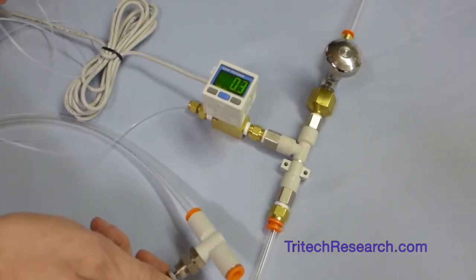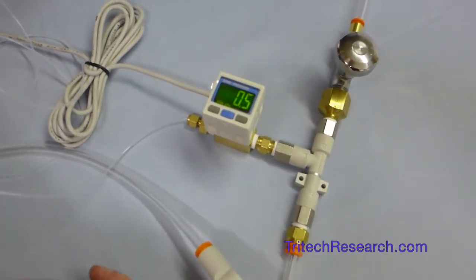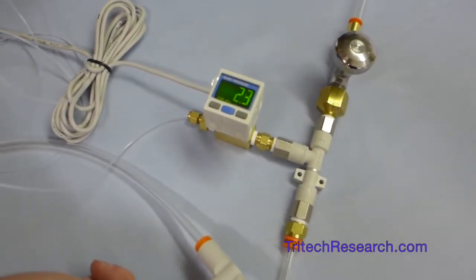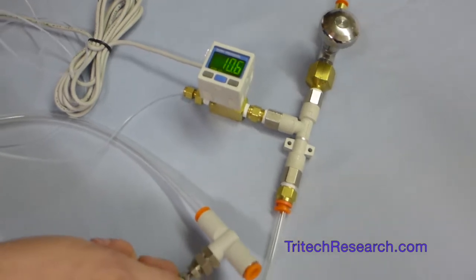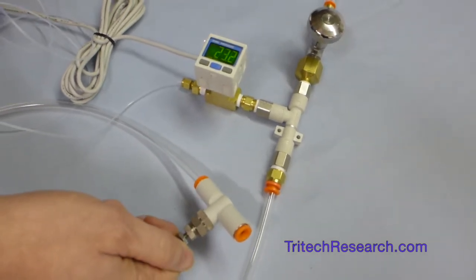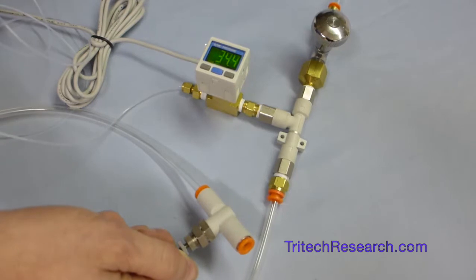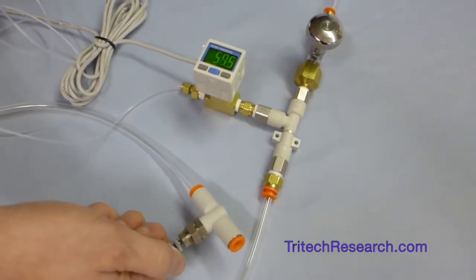And you'll notice that this gauge is set right now to switch between green and red. So when it's a positive pressure, it goes green. And then in positive pressure, as we use this, it's easy to get to a very high pressure.